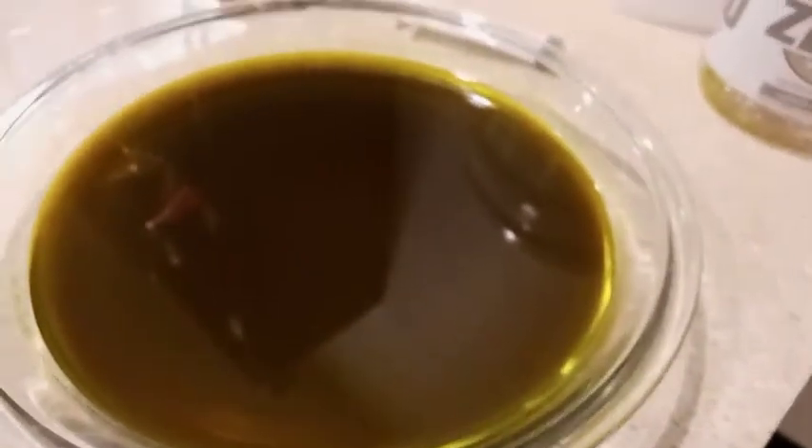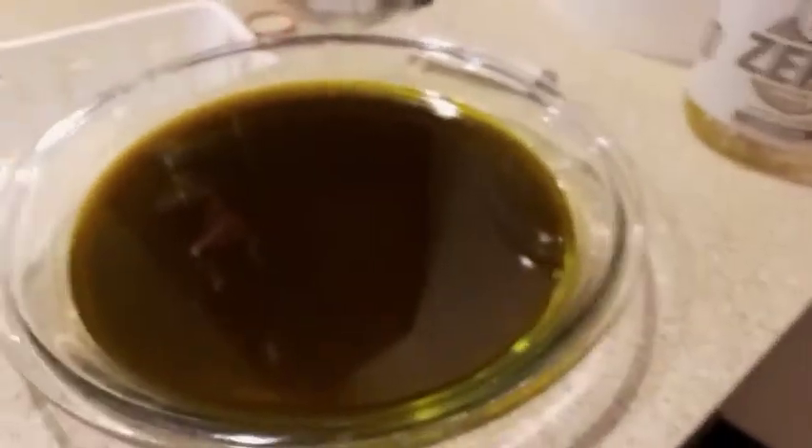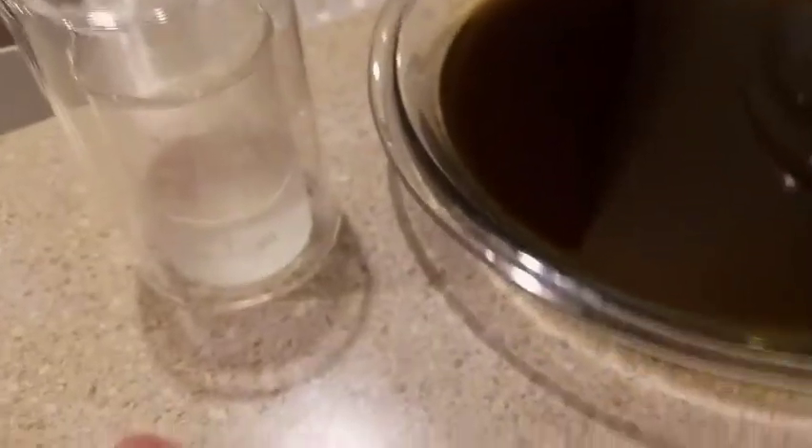I got frustrated and ended up with about half a gram from 400 grams of pepper. So I am restarting this to do it the right way — I'll only use the potassium hydroxide solution and wait on adding the water. Hopefully it'll go quickly, easily, and real smooth.